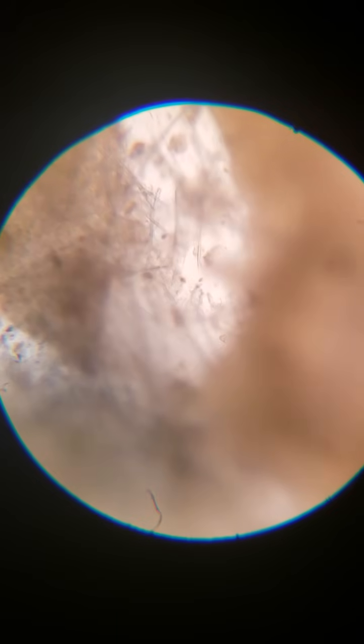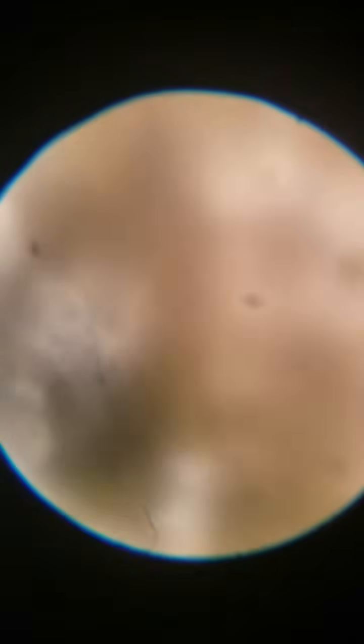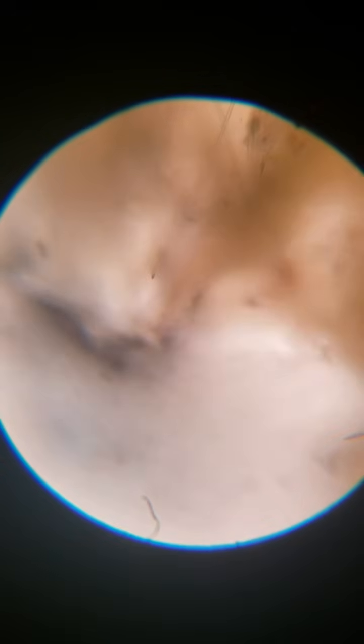But the ones that have the little round ends on them, like this one in the center here, you can see they have either a female or a male gender, and they wrap it all up together, get smushed together as I understand it, and they end up in these little dark spots which can break off.